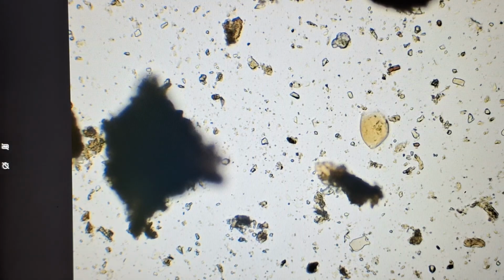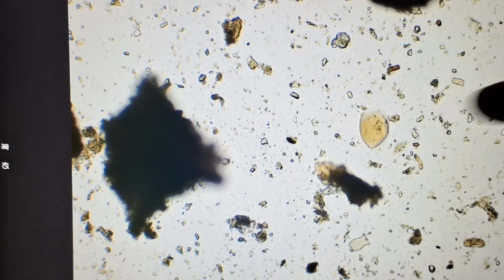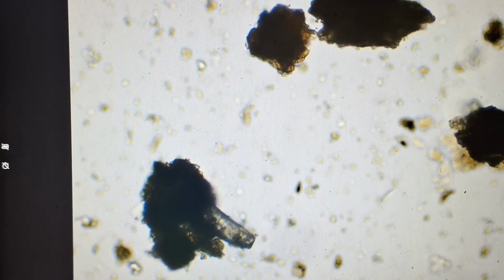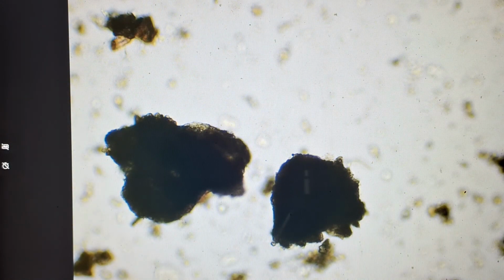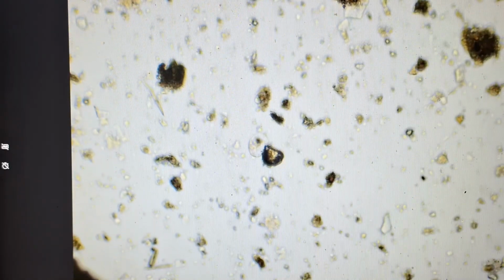We can back off to 40x. And here we're going to see some of those acids I was talking about. I believe that's a humic acid, a little darker color. We'll see fulvic acid will be a little lighter color. Nice amounts of organic matter around like these. That's what the fungi and bacteria are feeding on. It's a big shelled amoeba there, I believe, right there in the bottom left.